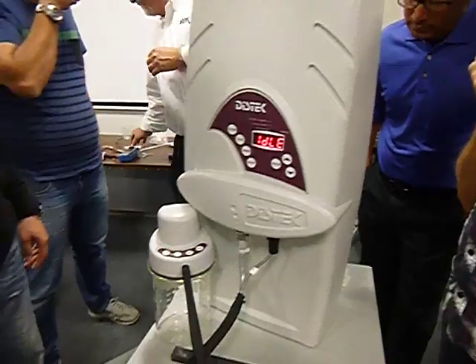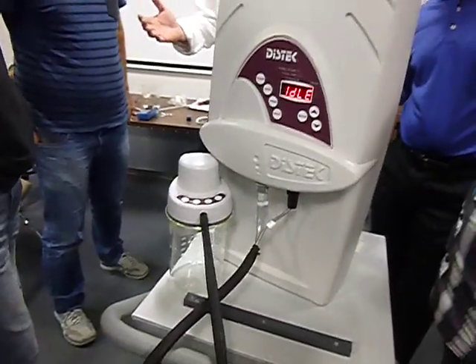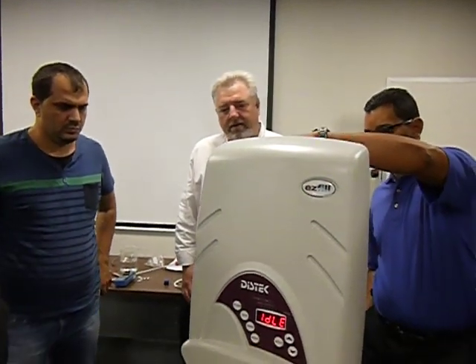You'll find a lot of places will set it to 38, because by the time you do the first one to the last one, and put it in the bath, the temperature will go down. Okay?